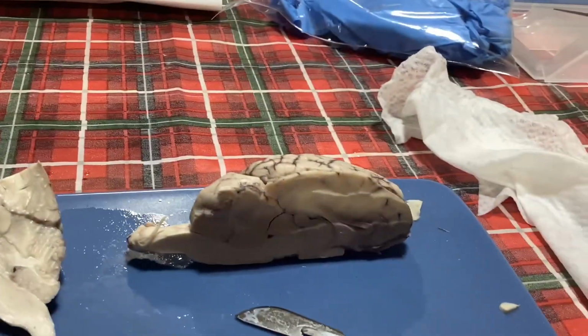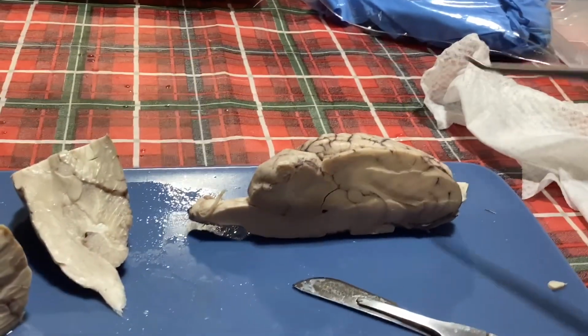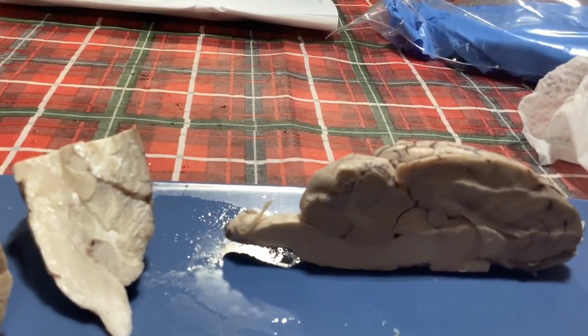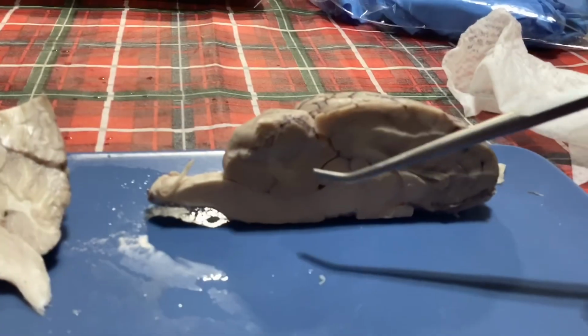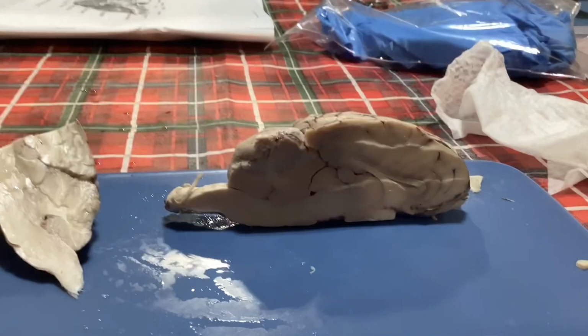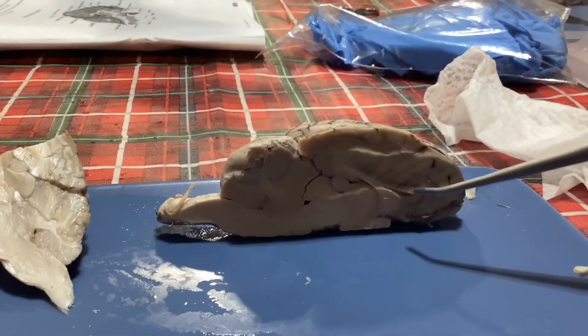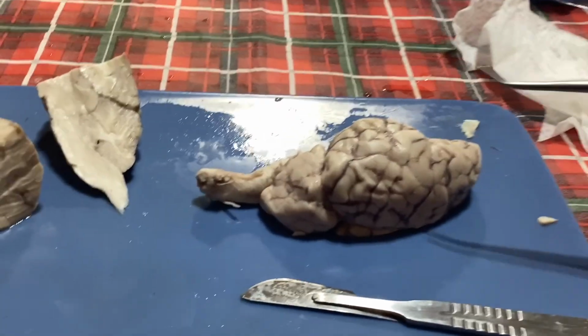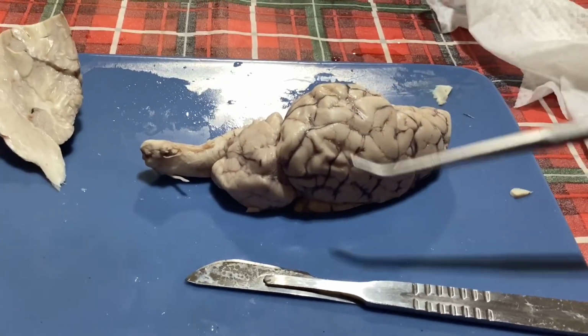All right, and then our cerebrum is going to be the entire top of the brain, like the whole thing, the whole brain. All right, and then we have the choroid plexus, which is going to be this guy over here, inferior to the cerebellum. All right, and then we have the corpus callosum, which is going to be this little guy right here. All right, the cortex is going to be the middle part of the brain over here, or the cerebral cortex.